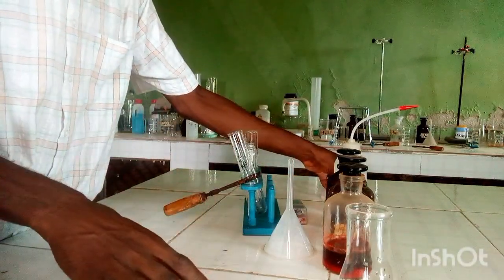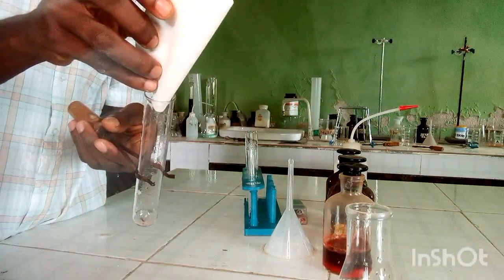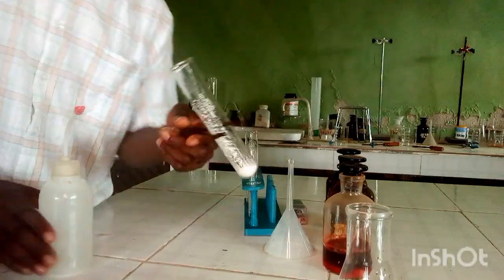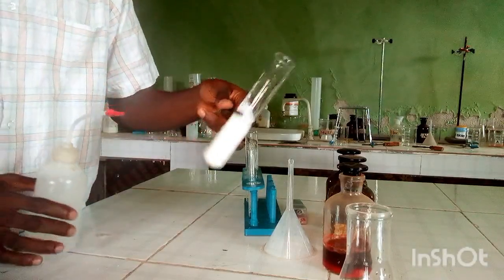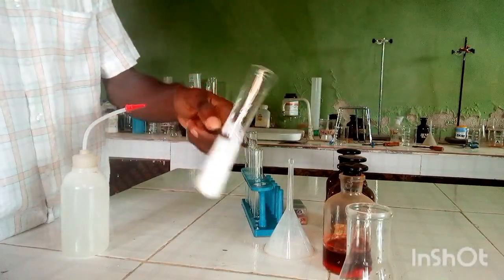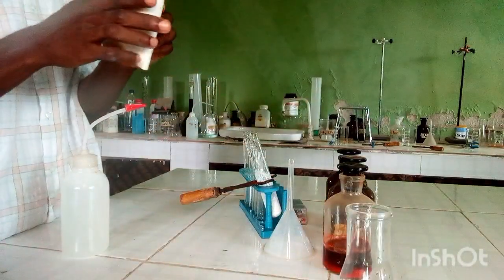We add a few parts of C into a boiling tube. I'm adding it now — I couldn't find the exact equipment but I'm making use of this. We just need a small fraction of it. I'm then told to add 10 cm³ of water — you don't have to measure exactly, just add enough water to dissolve your salt. My observation is that I have a white solution, and I'm still seeing a little suspension, so the observation is that a white solution is formed with suspension.